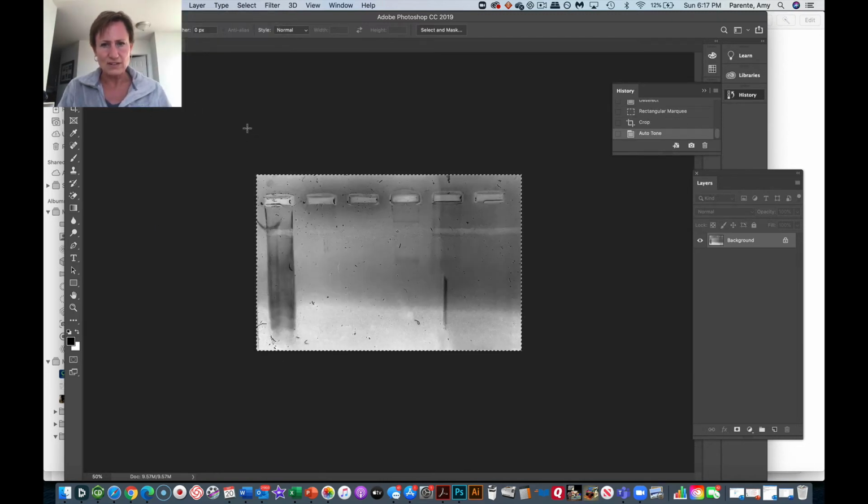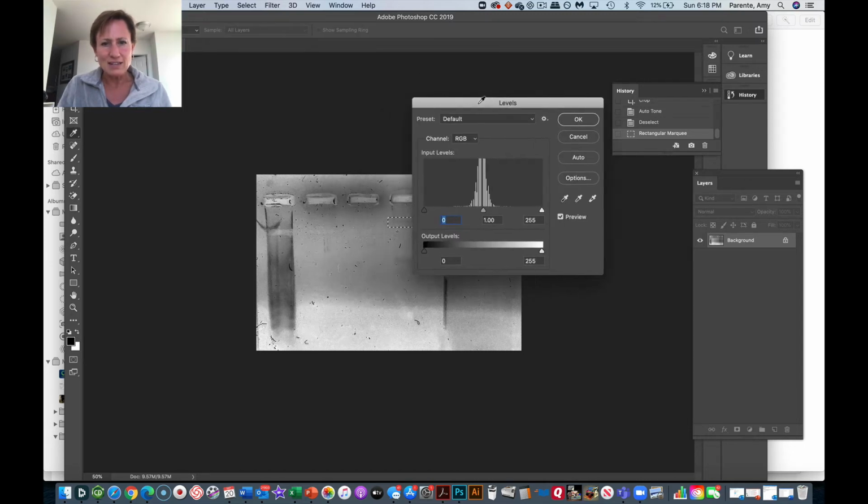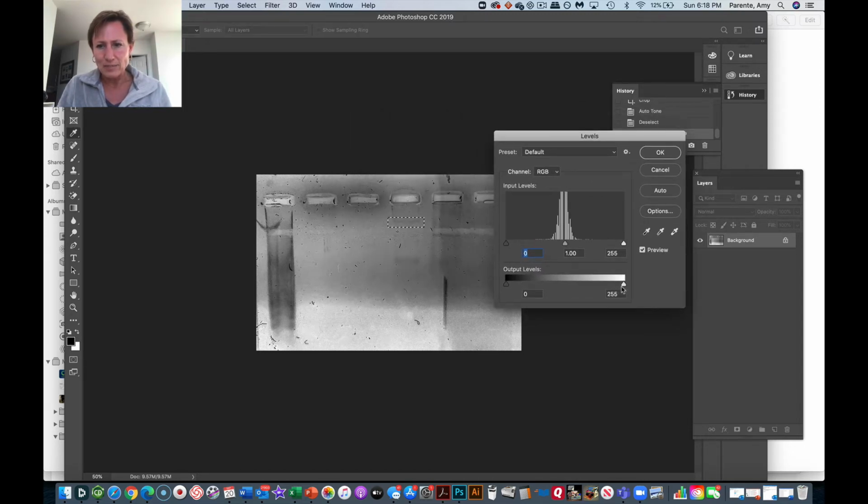Let's see if we can fix, oh there, we fixed the levels again. That actually made it better. We definitely can see a bit more of this band. Now here's what you do not want to do. Let me show you what some people try to do, and again, it's a huge no-no. They say, I want to see this band a little bit more. So I'm going to take that band and say, fix the levels on this band. I want to make it look darker.